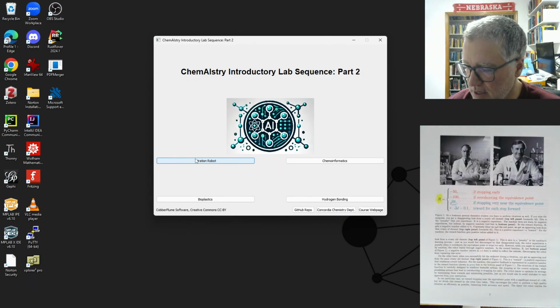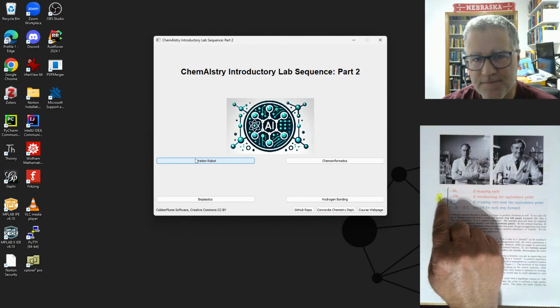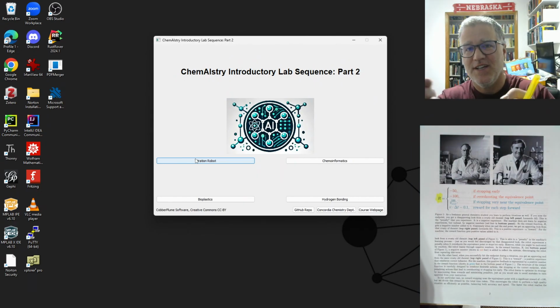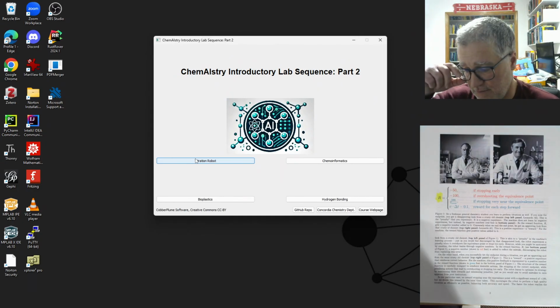Then we have this reward system. So the analogy here would be, if you are in general chemistry now or remember back to general chemistry and you're doing your titrations, you're trying to learn how to do them, and you go a little too far and you get well past that endpoint and your indicator turns bright, say pink if you're using phenolphthalein, and you get a disapproving look from your instructor that you didn't quite do it correctly. So that's the penalty. So we get this reward value R, we'll get a minus 100 if we overshoot that equivalence point. Also, if we come to our instructor and say, I think I'm there, and your solution is completely clear, and you've stopped way too soon before the endpoint, then that would also get a disapproving look. So if you stop early, that's also a penalty.